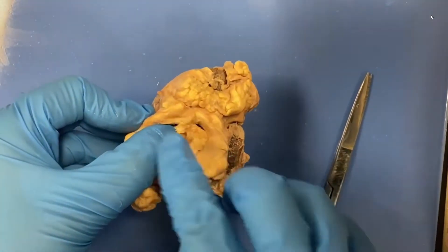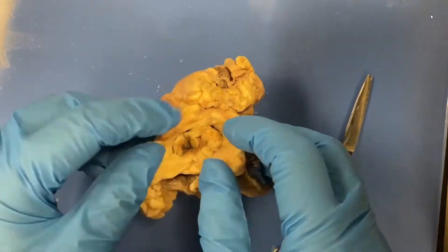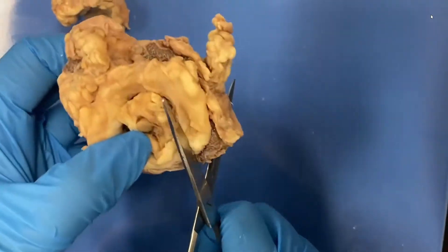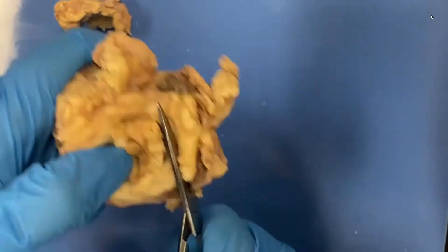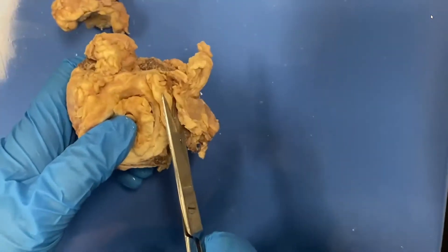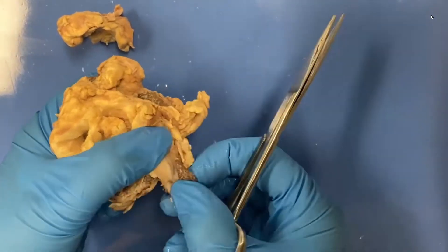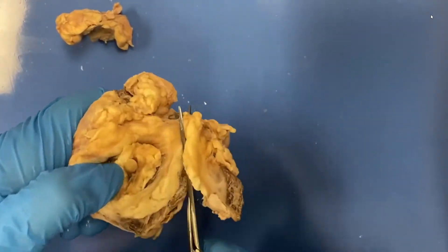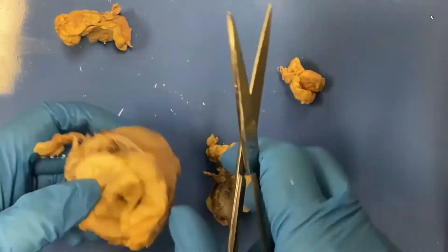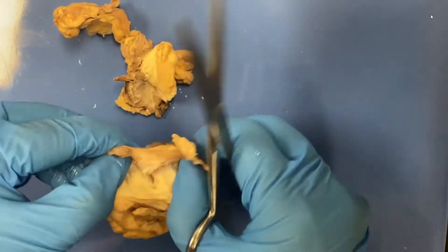I'm going to pause this for a second to take off some of this fat so we can get a better view of the eye. You can see that the yellowish-white is the fat, but I'm also cutting through some muscles. If you've done the muscles already, you'll realize these are the muscles to the eye — they're outside the eye, so they're called the extraocular muscles. And there are six of them.